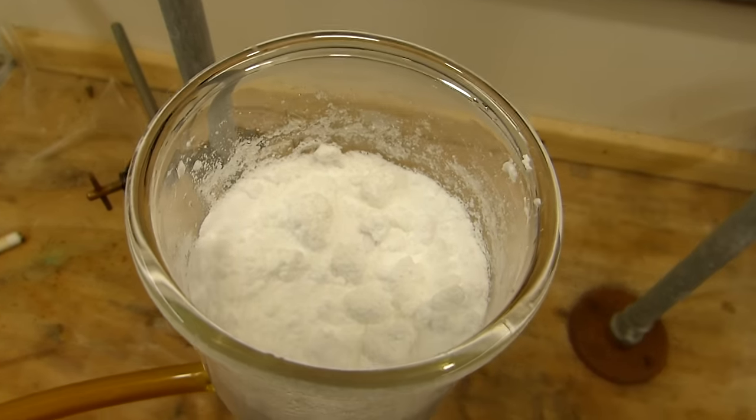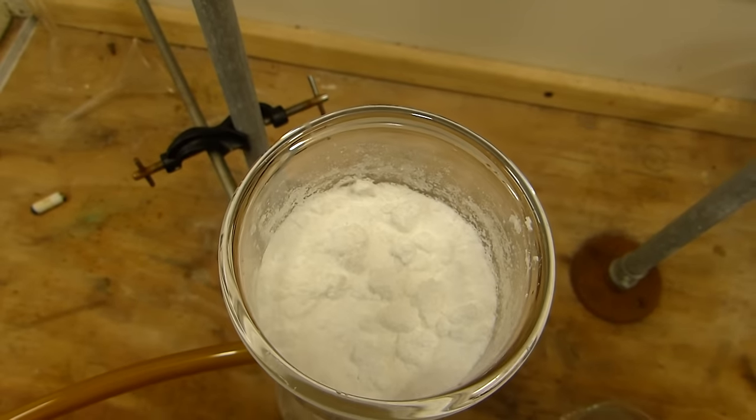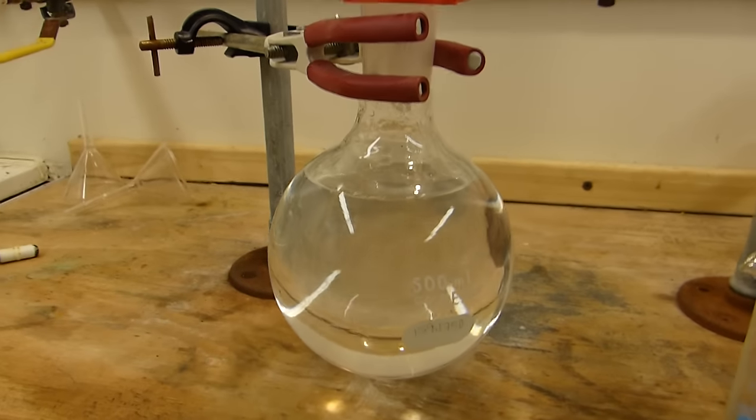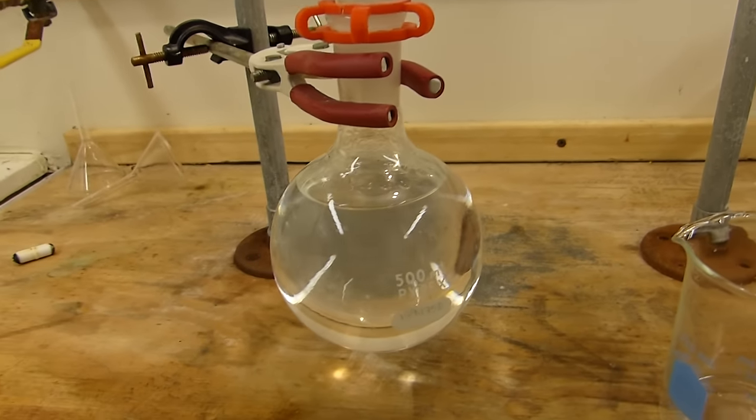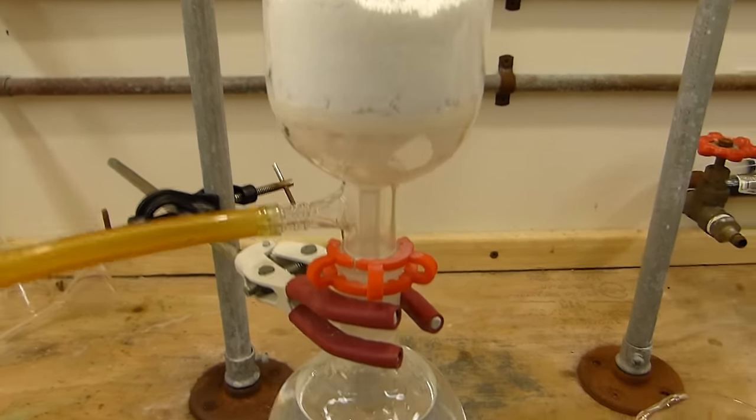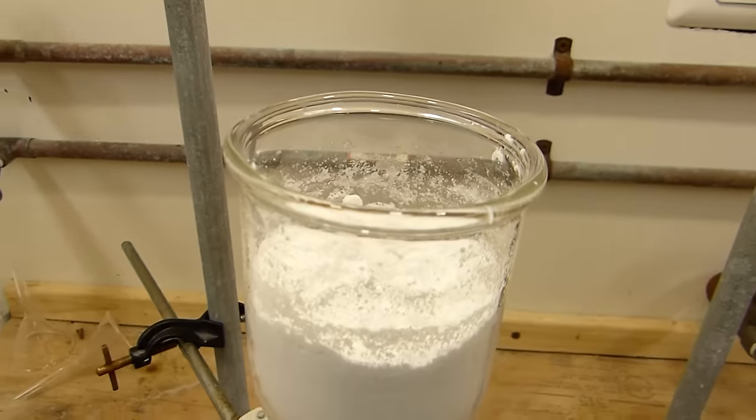I'll wash it with the ice-cold water. And you can see that the funnel is now full of a powdery white solid. I'll just leave this on the vacuum for a little bit to suck the last of the water out of it, and then go ahead and dry that.